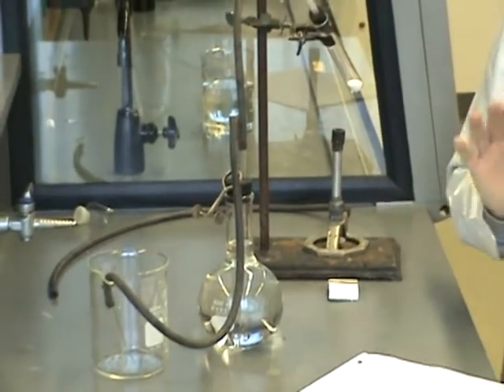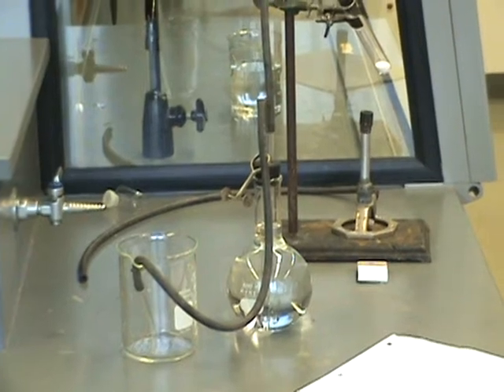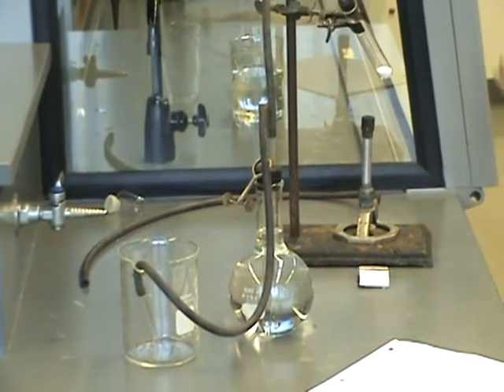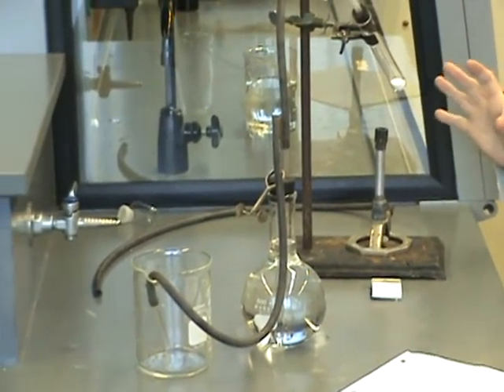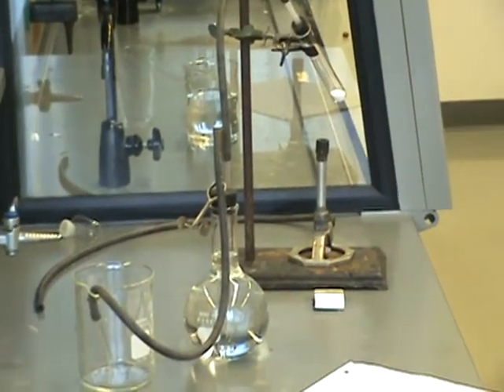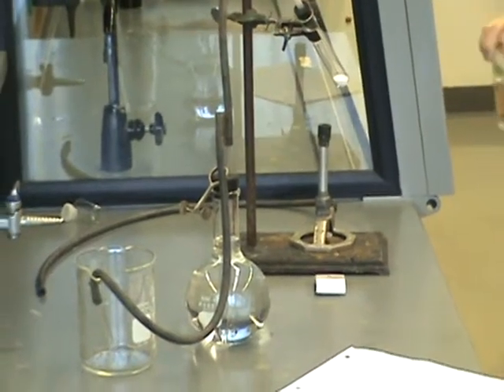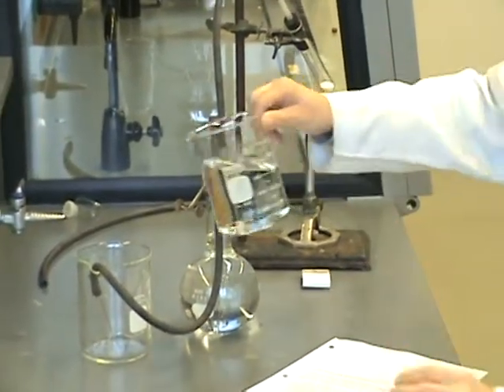Once the reaction is complete, there's one more step you need to do. It says, after the reaction is complete, leave it as is and let it cool to room temperature. Then we need to equalize those pressures one more time. So, I'm just going to illustrate what it might look like to you when you're done. When you're finished, there'll actually be some water in this beaker that's been displaced from the flask.